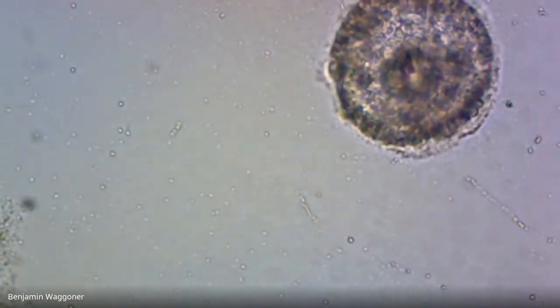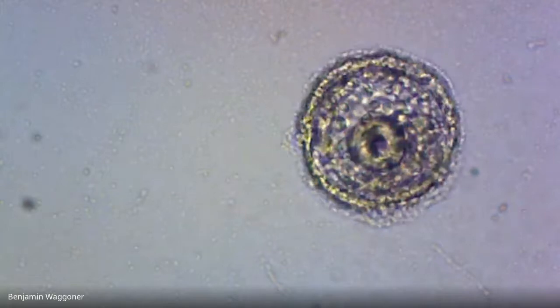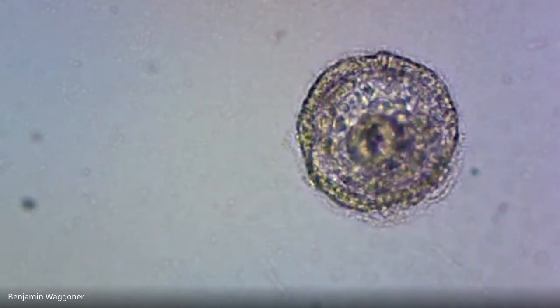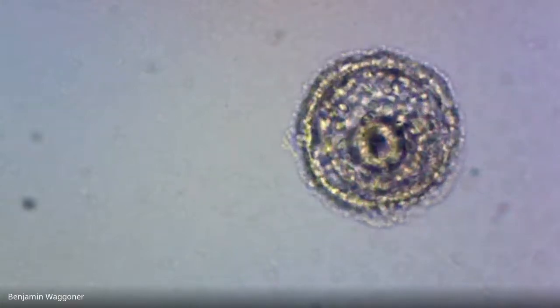All right, I'm seeing several more. You may not be able to see them all because my field of view is wider than yours. But I'm seeing more that just look screwy, although, again, I can't tell the difference between screwy because they're bacterized, and screwy because they're developmentally screwy. But there you've got another gastrula.